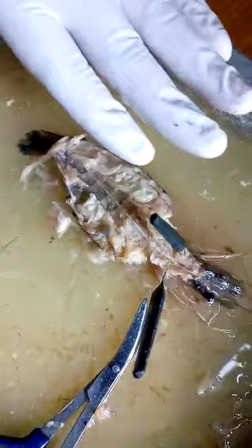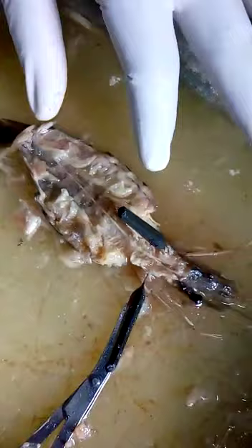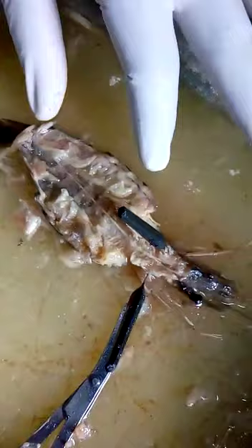The system is now completed. For demonstration purposes, you have to keep this. Make it clear and learn it all. Now we will go to the next topic: appendages. Appendages — learn a bit about appendages.